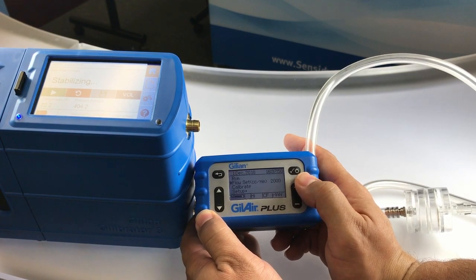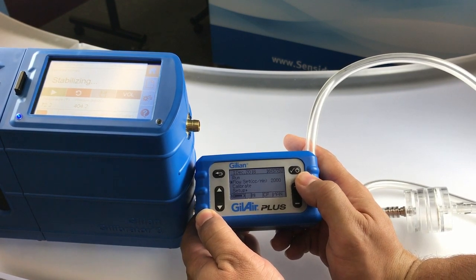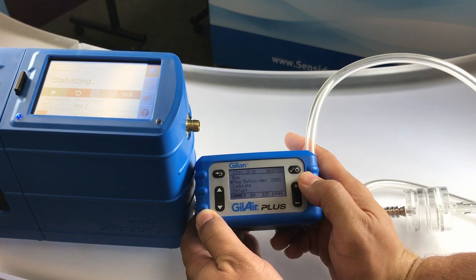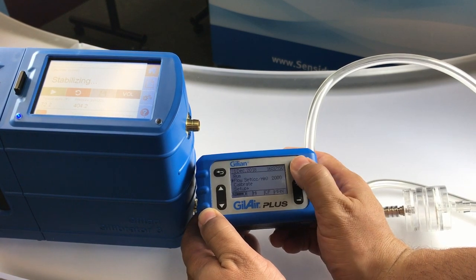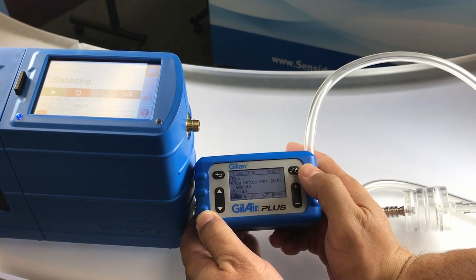For this demonstration I will set it at two thousand cc's, or two liters per minute, and then I must press enter again to make sure that that's locked in.